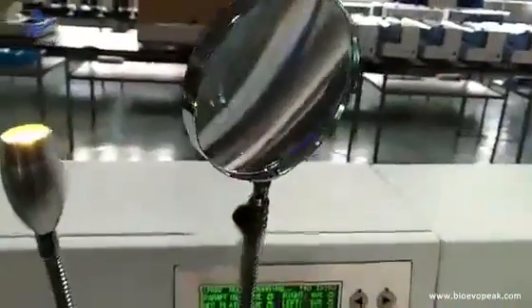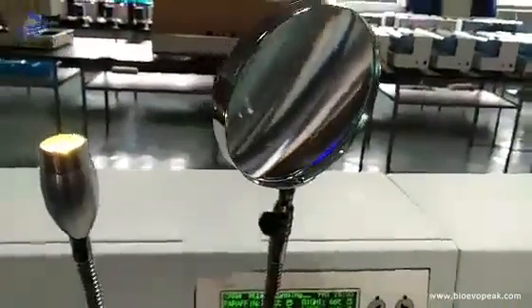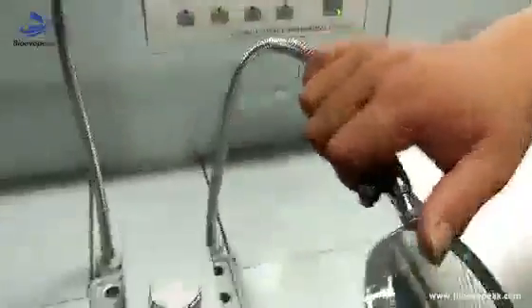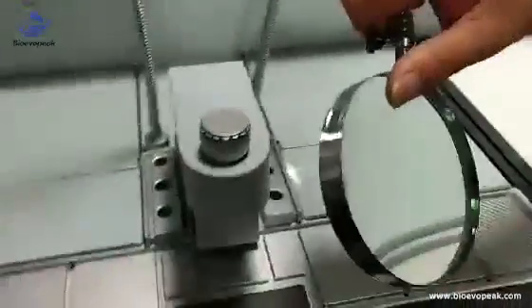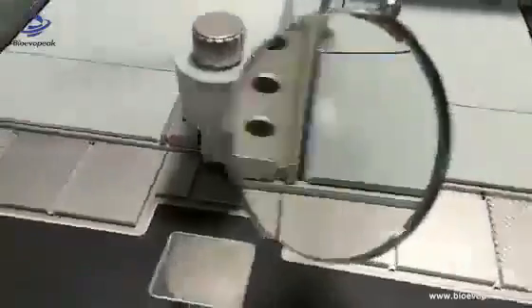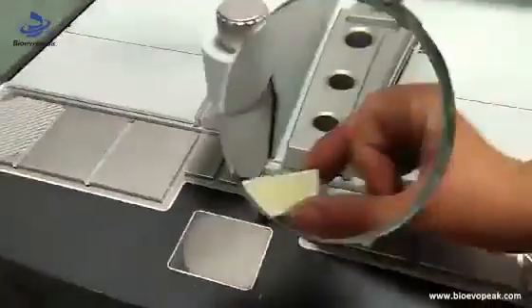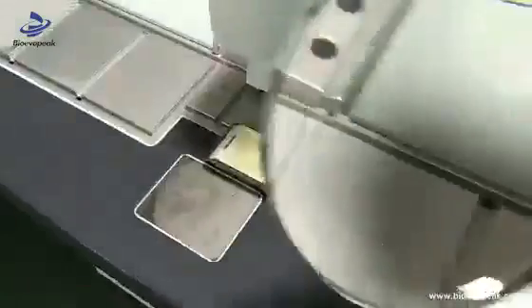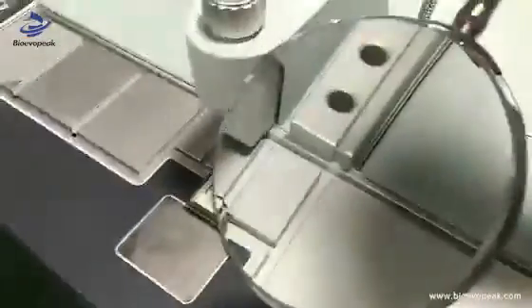The right part is the magnifier. The magnifier is used to see the micro tissue specimen clearly.